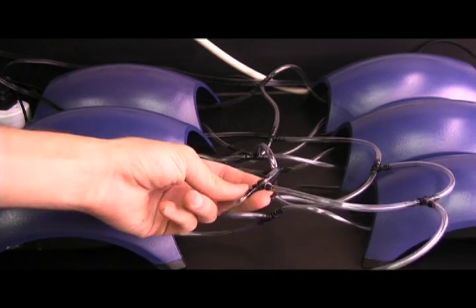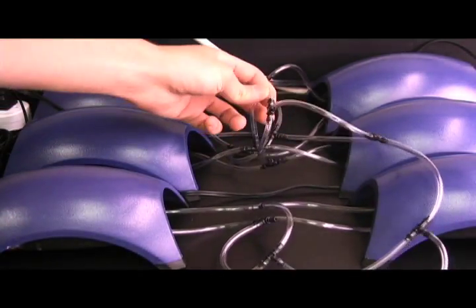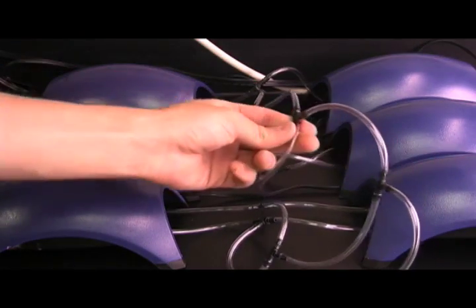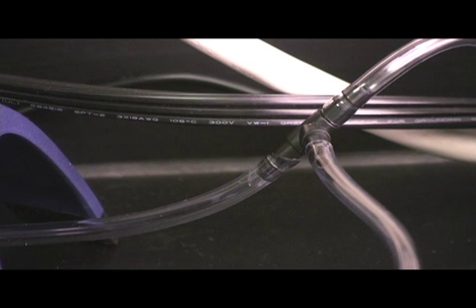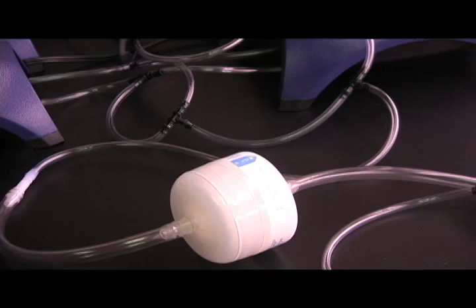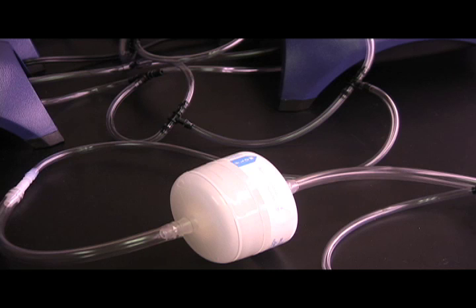For our setup, we ran airline tubing from six combined Whisper Tetra 100 air pumps into our systems. The Tetra 100s were combined using T-valves and ran into a HEPA filter, which reduced possible contamination.